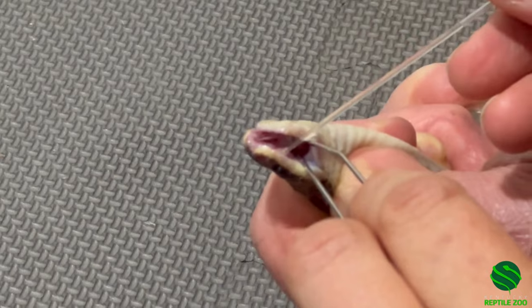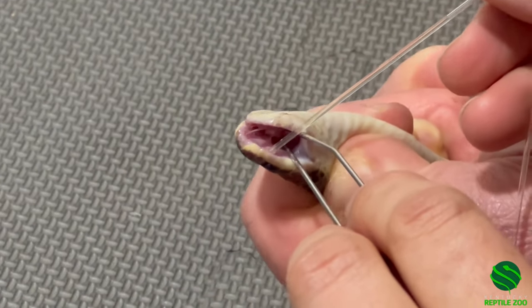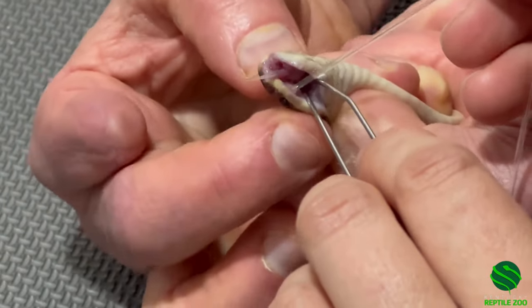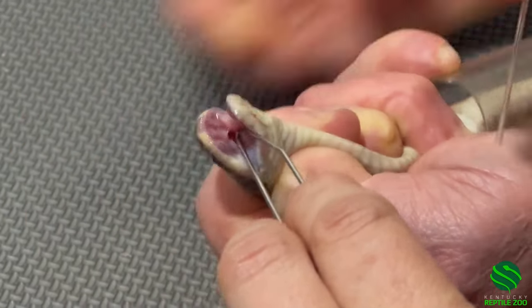I got it. And you just gave — yeah I did. That was pretty good actually. I'm going to take this one off to do the other one. Squeeze it off. I don't think he gave anymore. It's off. I think you guys are pretty good about it.